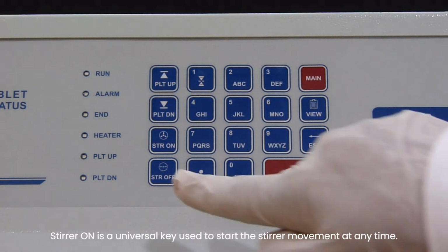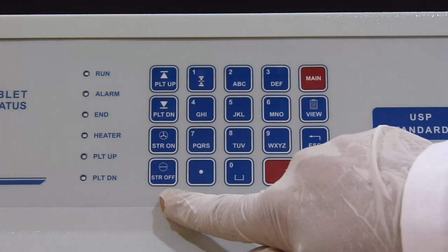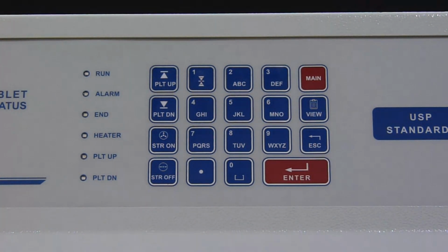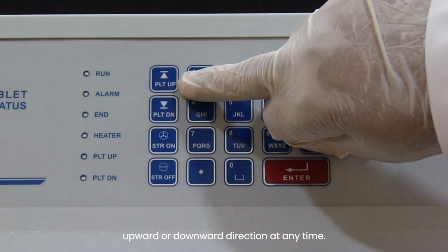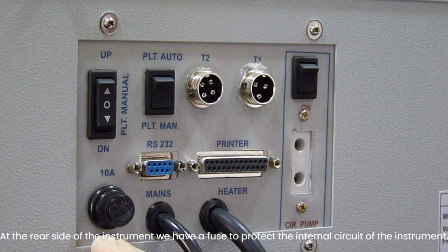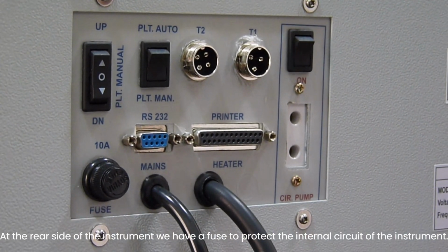Stirrer on is a universal key used to start the stirrer movement at any time. Stirrer off is used to stop the stirrer movement at any time. Platform up and down keys are used to start the platform movements in the upward or downward direction at any time. At the rear side of the instrument, we have a fuse to protect the internal circuit of the instrument.